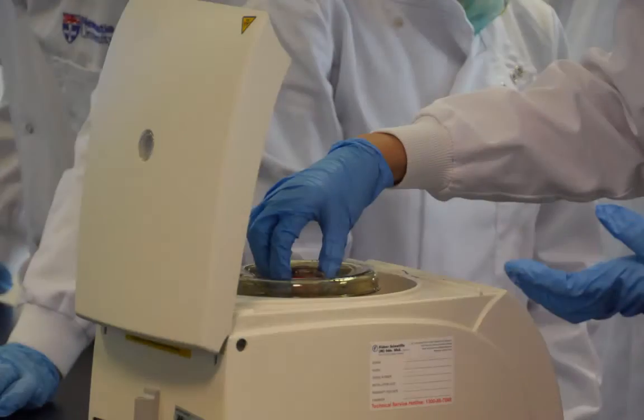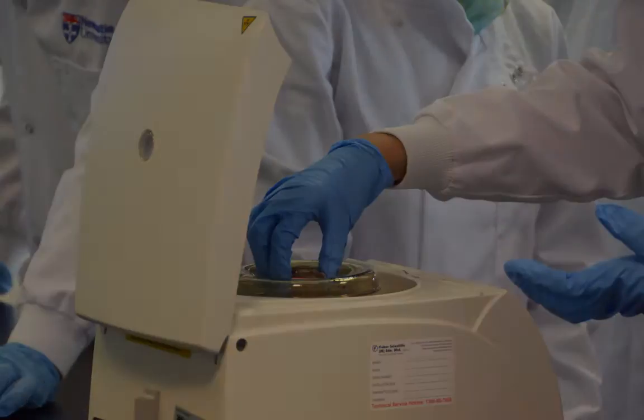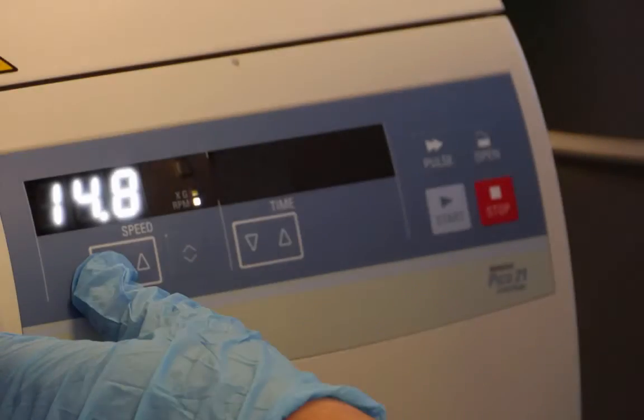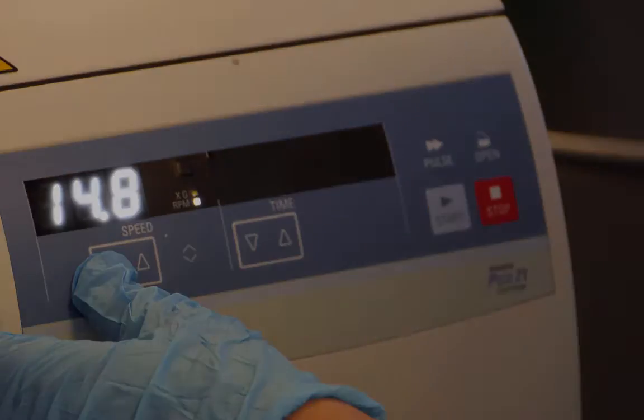The samples were balanced in the centrifuge and the lid placed on the rotor and the samples were then centrifuged at maximum speed for 3 minutes.